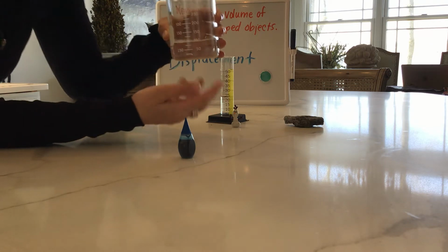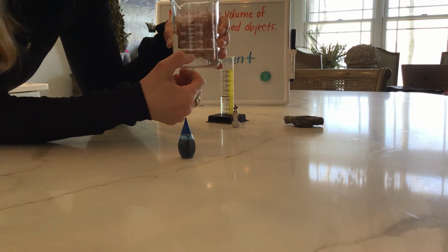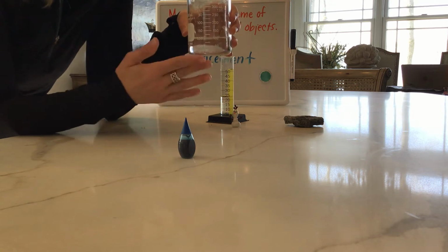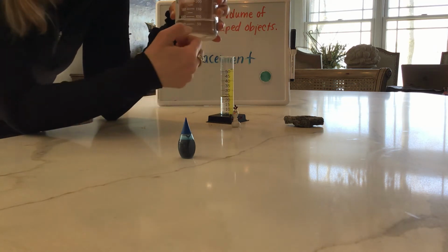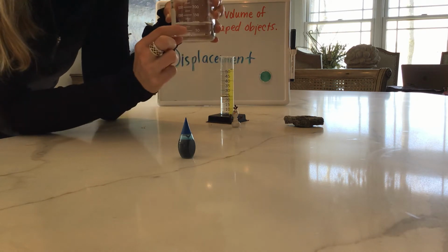So if it goes 50, blank, 100, I have to think, okay, so there's 50 between the 50 and the 100, right? Because 50 plus 50 is 100. So this middle mark must be whatever is halfway between 50 and 100. And I know that that's 75. So I think to myself, well, it must be going up by 25s each marking.